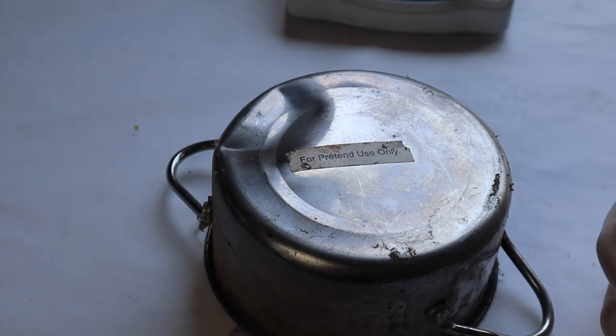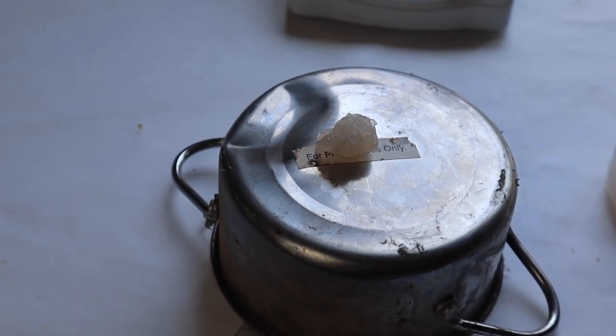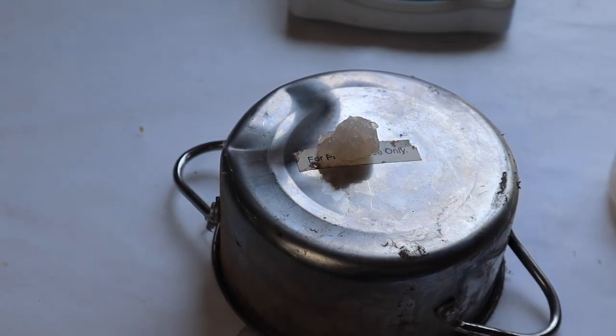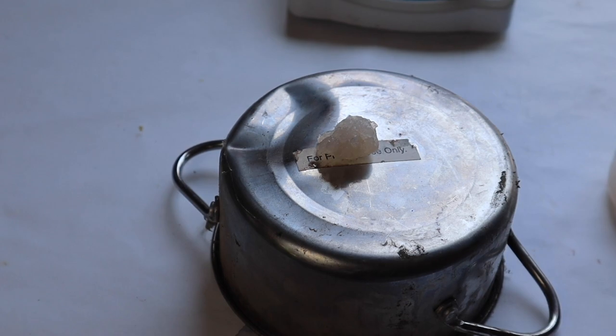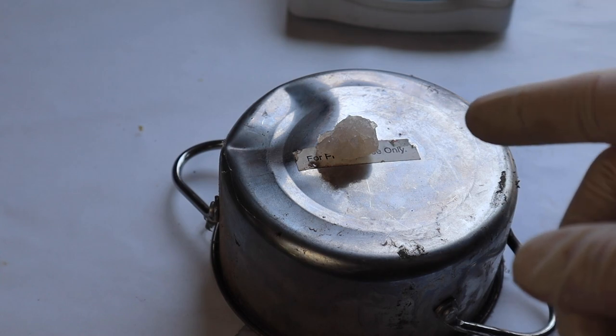So this jelly is actually used in cooking. It's known as Sterno. By the way, the alcohol I used was denatured methanol, but you can use ethanol. I actually recommend you use ethanol. It's a lot more safe, but it doesn't really matter too much. So I'm going to light it on fire now.